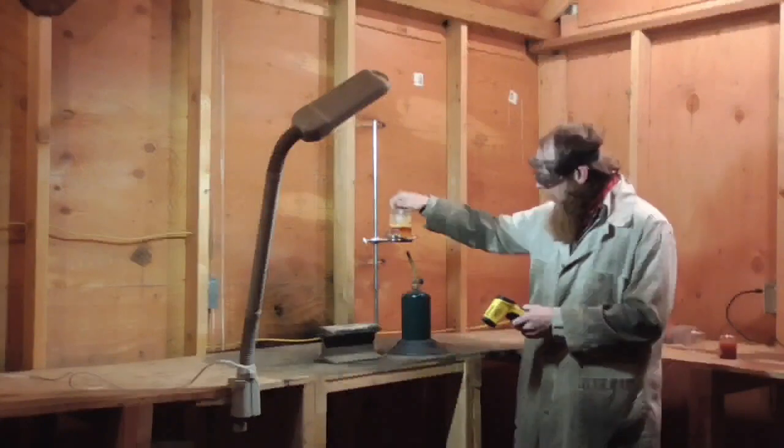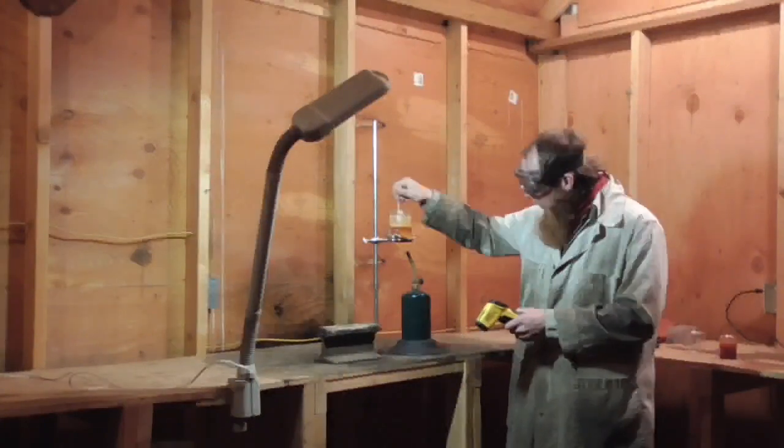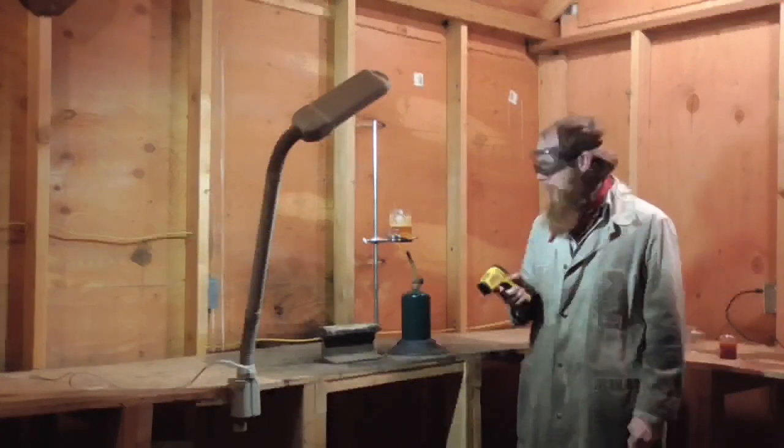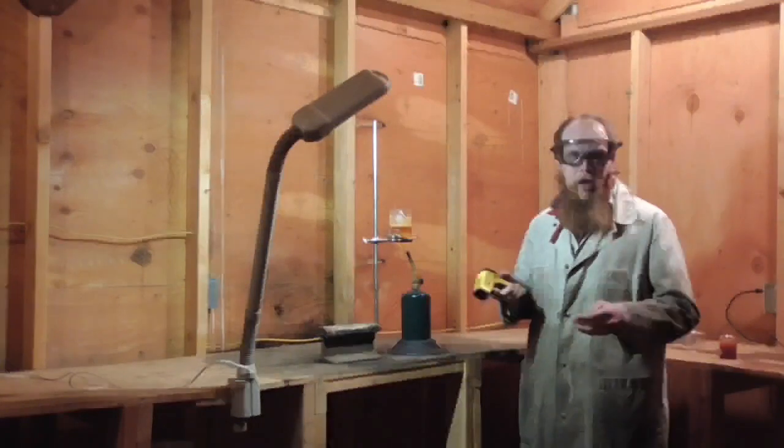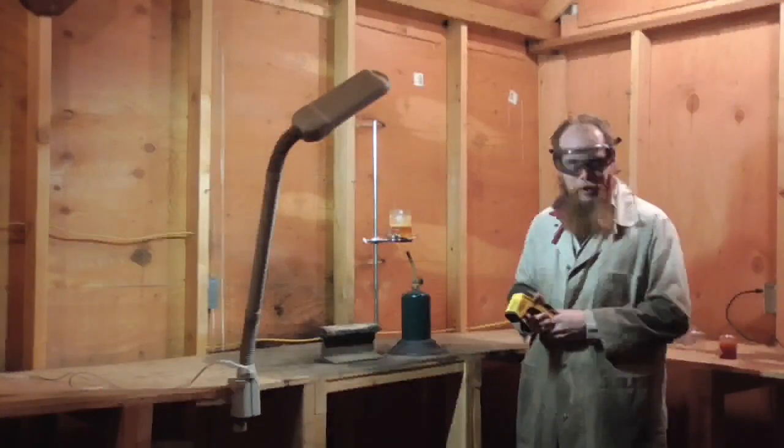And the bubbling created this frothy head that looks very reminiscent of soap. So it looks to me like our experiment was successful. I'll pour it off and let it solidify fully, and then we'll take a better look at it later.